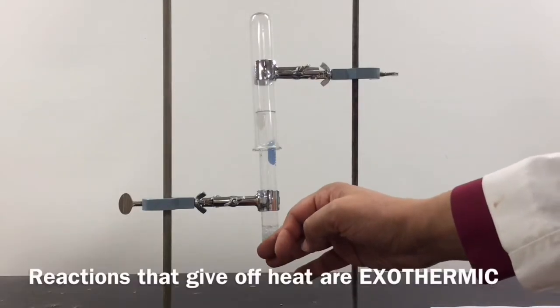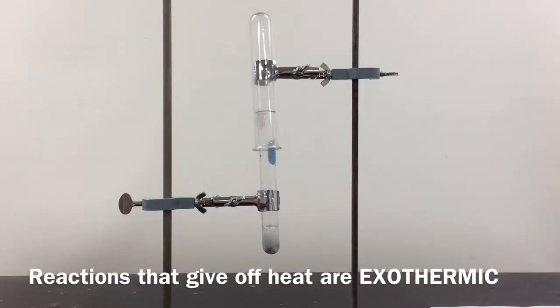If I touch this, I can feel that the test tube is getting very warm. In fact, it's quite hot. So this is an exothermic reaction.